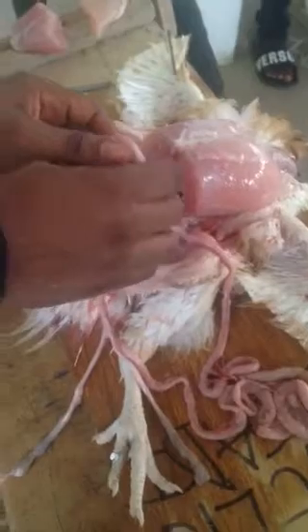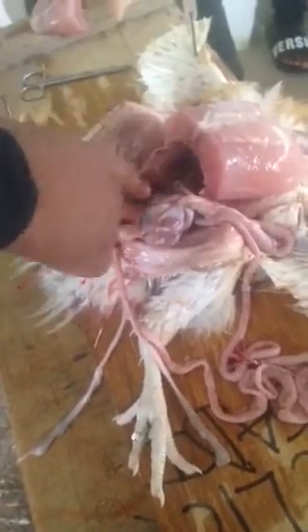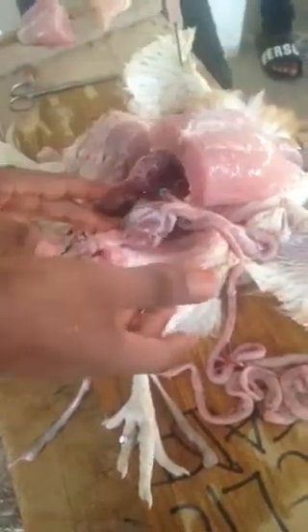Diverticuli. From here, we have the small intestine. From the small intestine, we have the duodenum, along which we have what? The pancreas. Some teachers will ask you to remove it. Don't remove it. If you remove it all, you'll not be able to see the pancreas conspicuously. You leave the pancreas, let's see it, a leaf-like structure. From the pancreas, you have what? The liver. The liver lobes, left and right liver lobes. In between them, you have what? The gallbladder. You know all the hormones that all of this secretes.